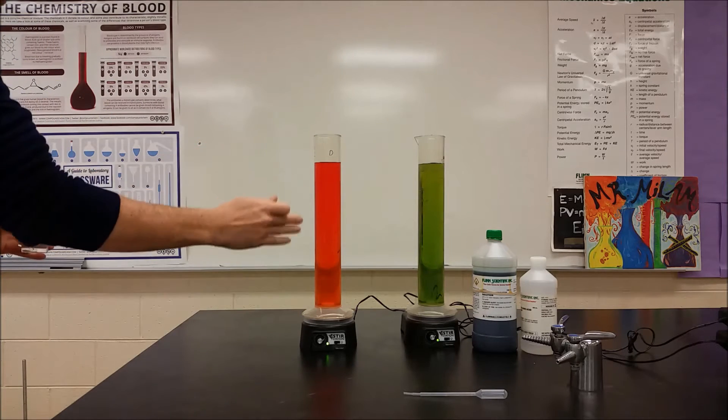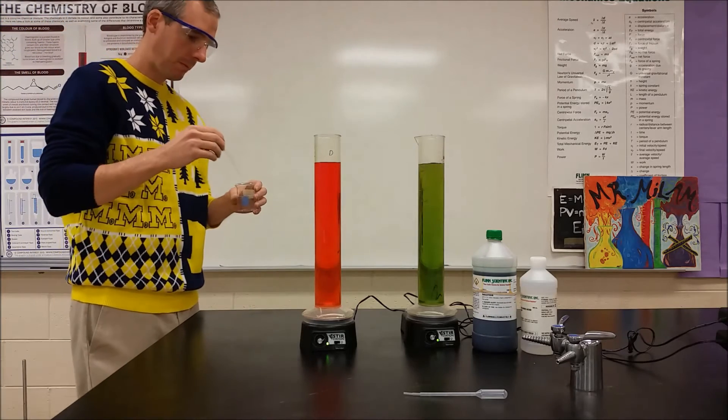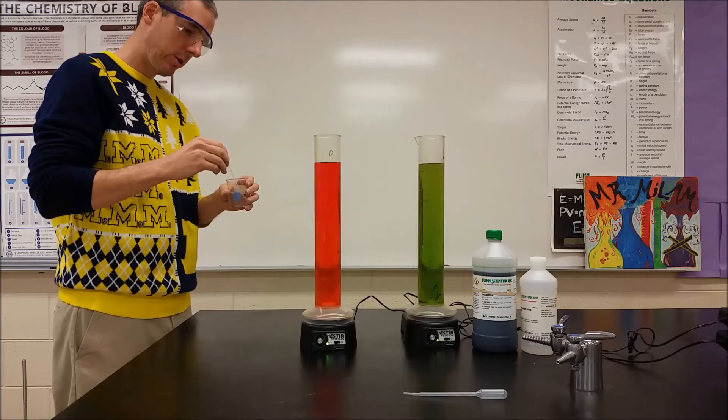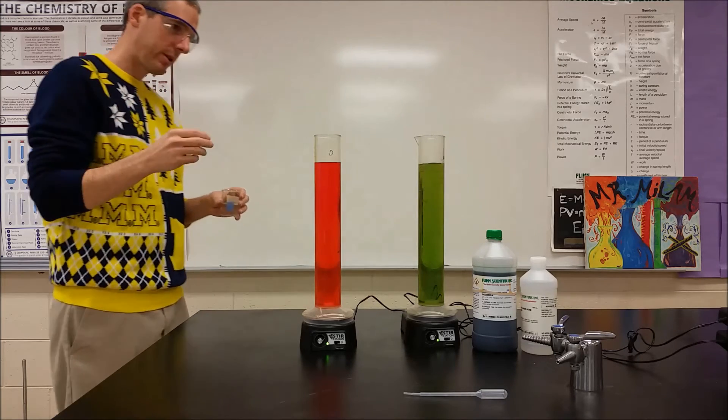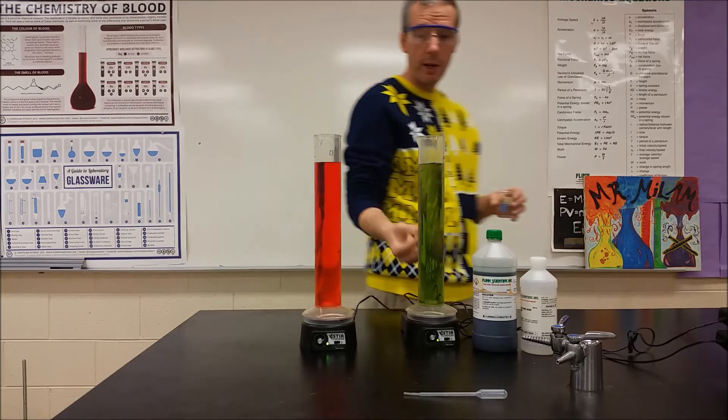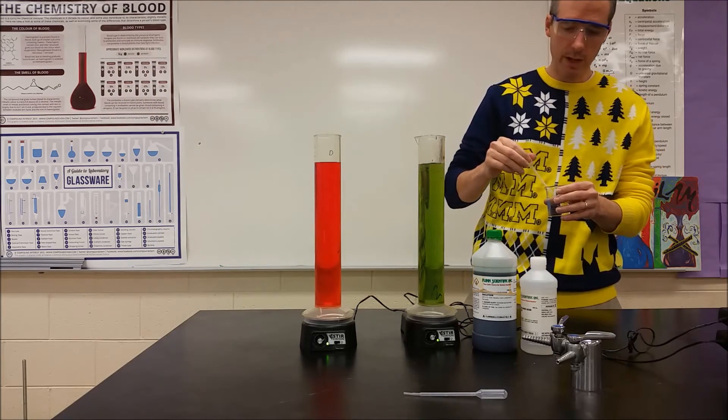And on my angle, this is kind of a dark orange approaching right at the top and very orange at the bottom. We'll do one more and that should hopefully take it over to red as long as that mixes well. Whereas over here, we've added over 10 milliliters and we're still at a green. Now, it looks like it's shifted a little bit more yellow than blue.